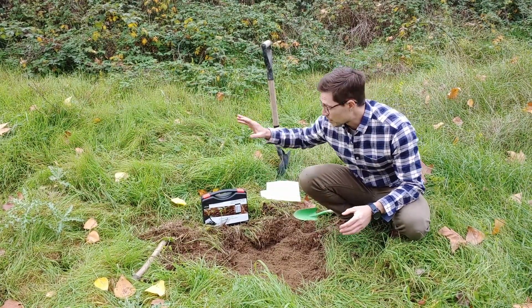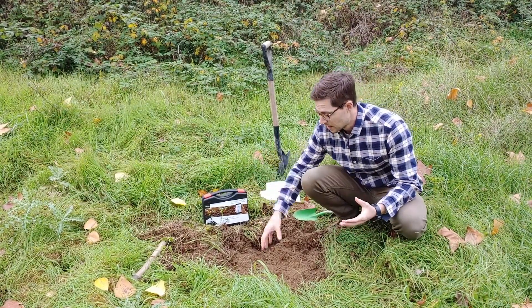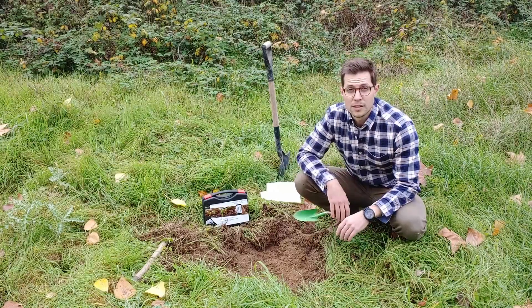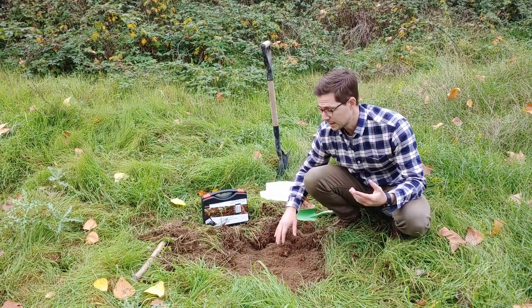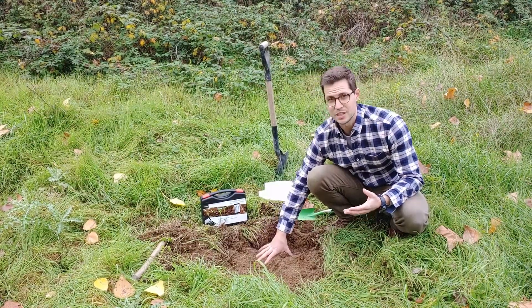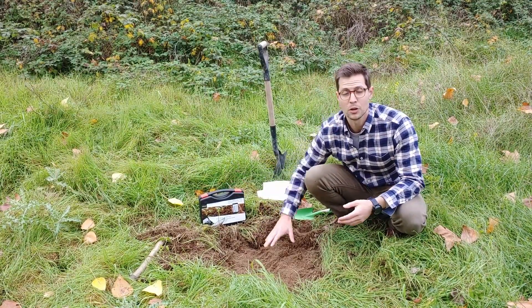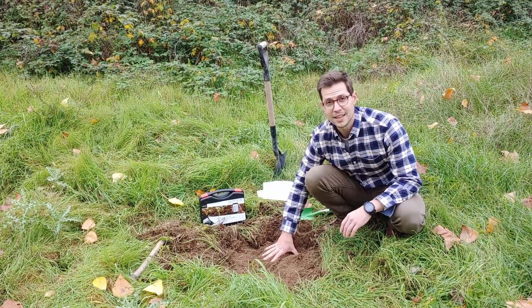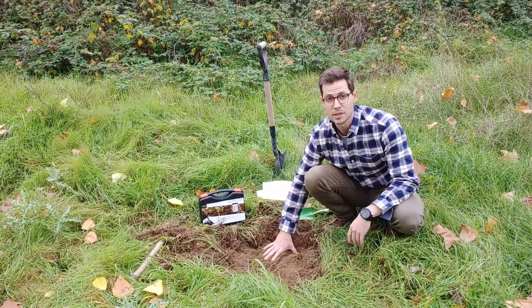The other thing that's really important for this test specifically is that the soil is what is called field moist — it's been humidified, with a little bit of moisture from rain, not from a bottle of water you pour on it. It won't work the same way. Most of the active microbial activity in the topsoil can only thrive in moist conditions. If the soil is really dry, or if you just pour water on it at the moment of sampling, it doesn't have time to proliferate and won't give you an accurate representation of what's in your topsoil.